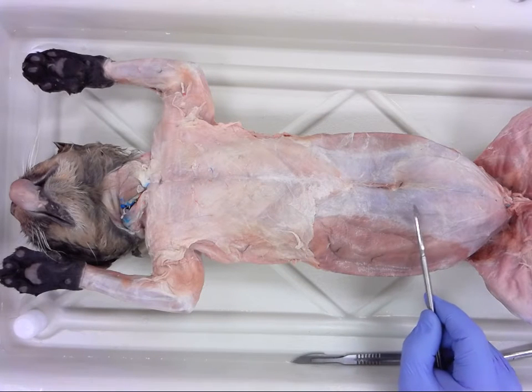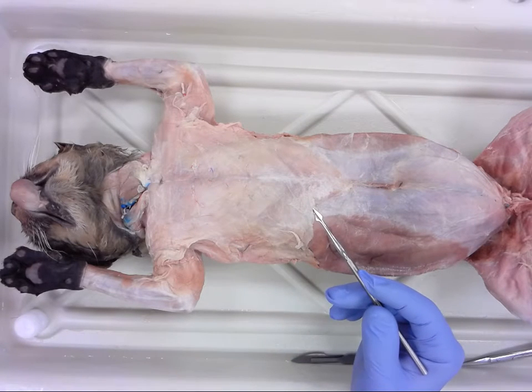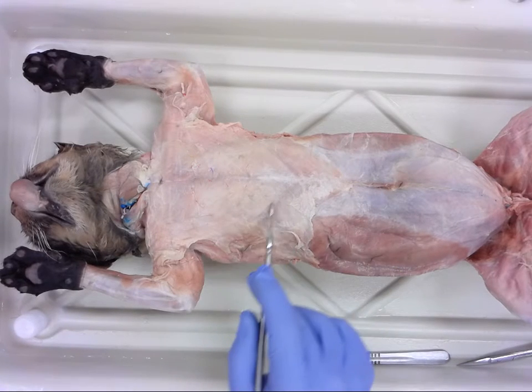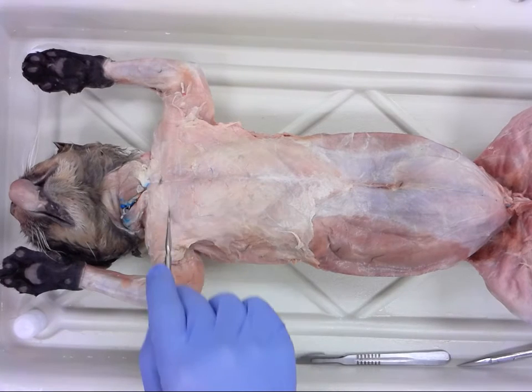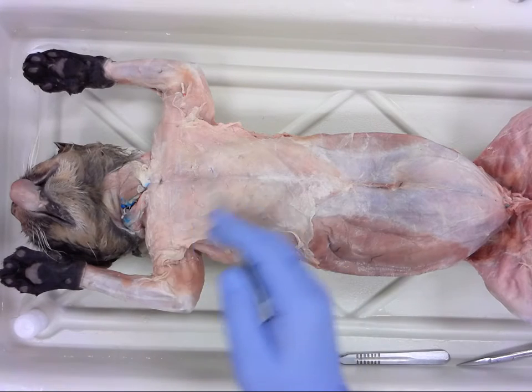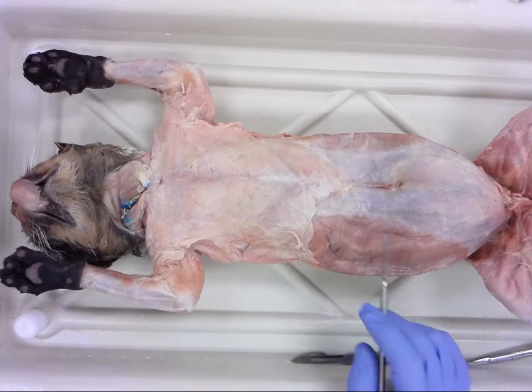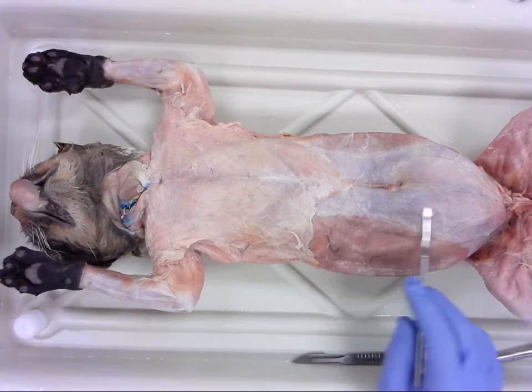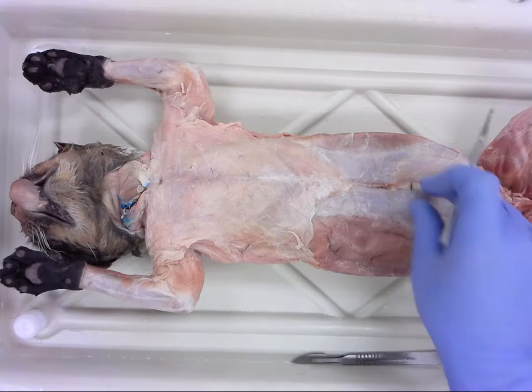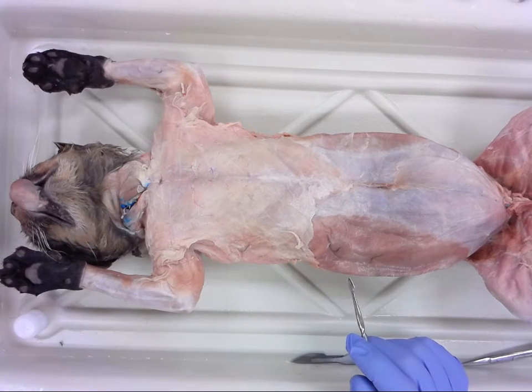Okay, so the pectoral muscles are going to be in the chest, and you can already start to see, I'm not sure how well this view is going to show it, but you can start to see muscles that are angling out to the arm or to the forelimb. These are going to be our pectoral muscles. All right. We also, forming the abdominal wall, are the abdominal muscle groups. Many of you are familiar with the rectus abdominis, the obliques, all of those. We will get into those very, very soon.